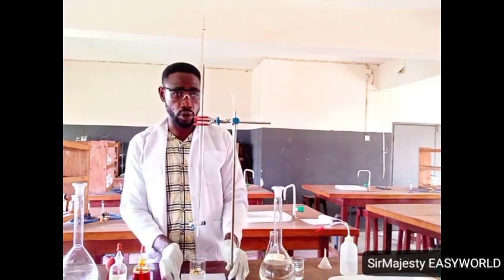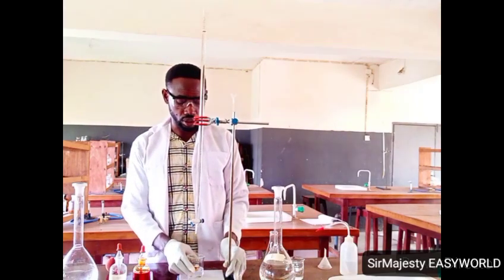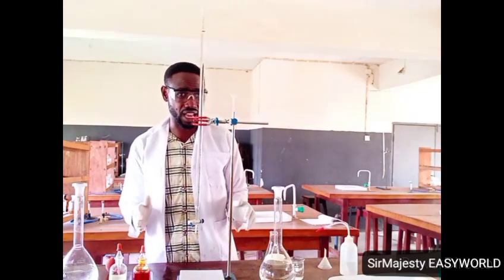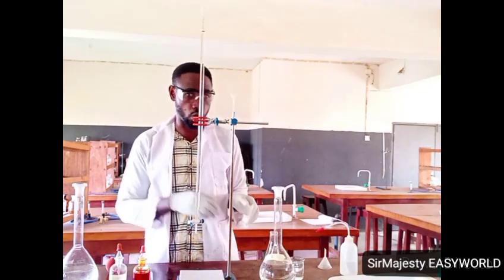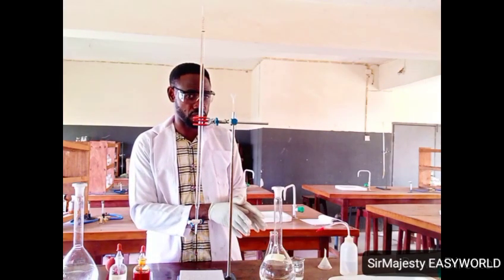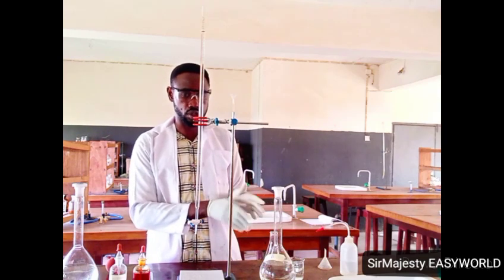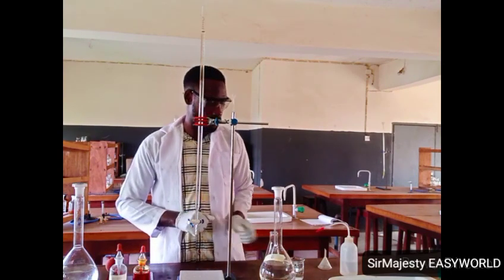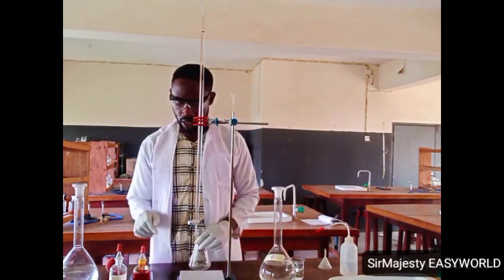Although in my separate video I will show interested scientists that this assumption, that when you mix sodium carbonate and sodium hydrogen carbonate they coexist, is not right. There's some sort of chemical reaction taking place there such that one will no longer be existing, or rather the concentrations might change. But for the sake of doubt, let's just handle this double indicator titration.